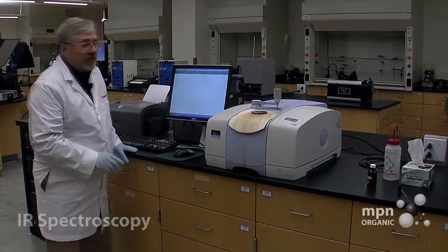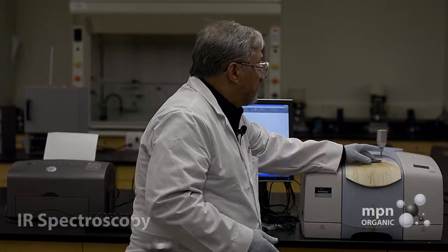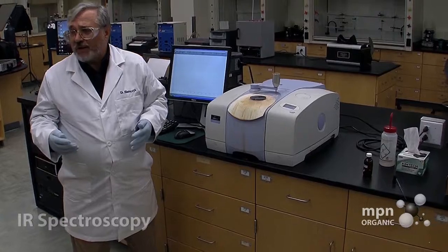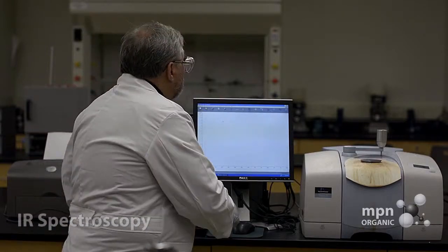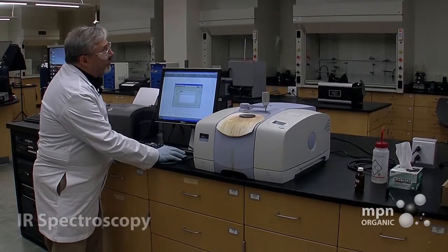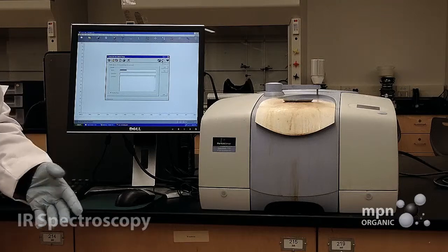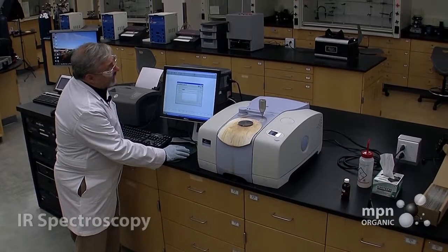The first one that we have to take is the scan of what we call the background. Now, we have this disk over here, and it's got in the middle of it a little bit of diamond material in it, and we have to take the background of it, which will be subtracted then from all of the infrared spectra that we take. So we go to scan, like that. We come to this particular window. And then over here in the upper right, we have an icon that, to me, always looks like an eye with an eyebrow. And if you land on it, it says background. So we're going to click that.